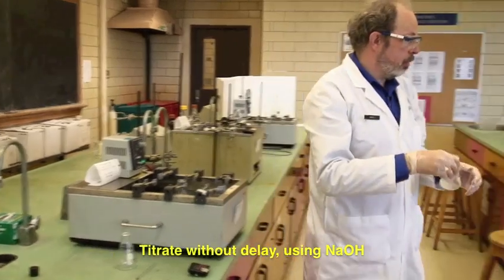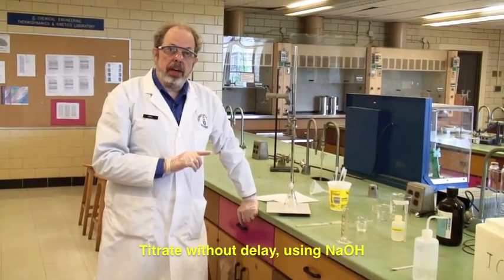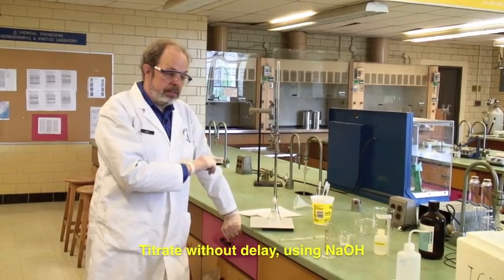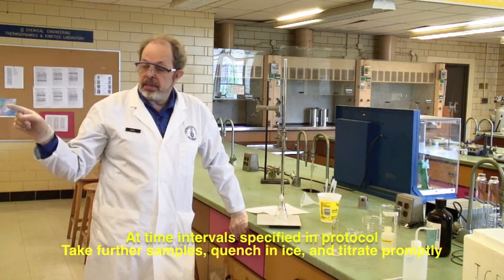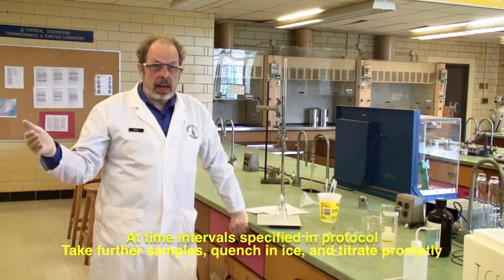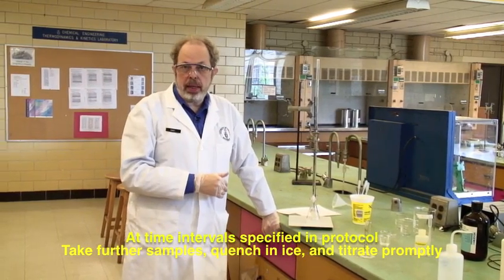And I now swirl this around and titrate it against sodium hydroxide. You titrate this, get the record, and then at the timed intervals specified in the protocol, keep taking samples. Treat them exactly the same way. Add them to ice and titrate as promptly as you can.